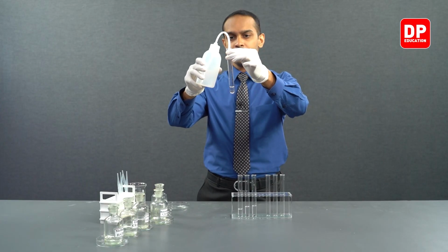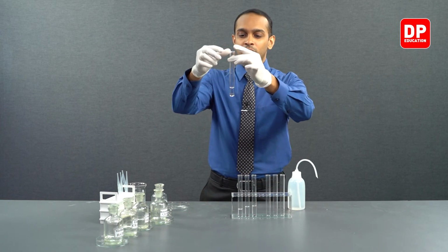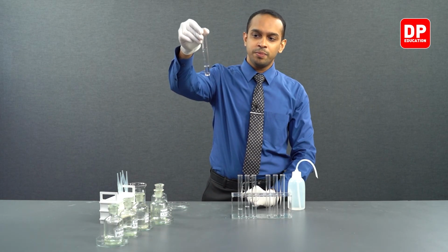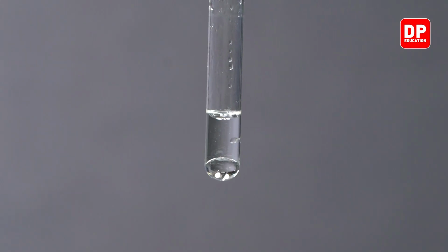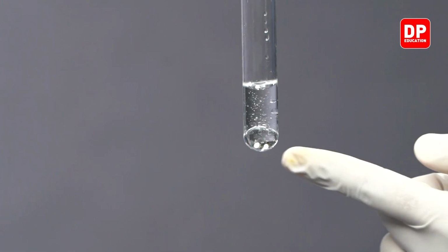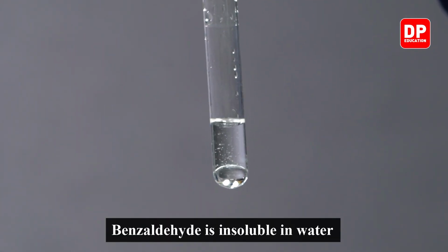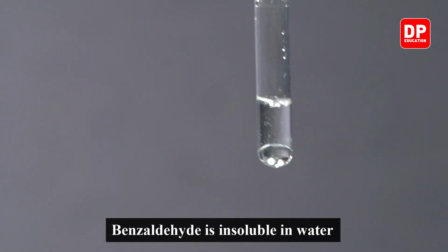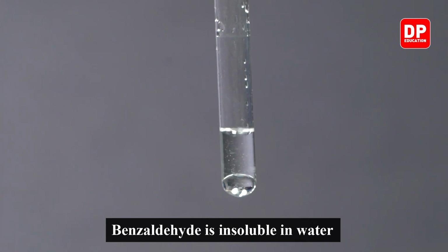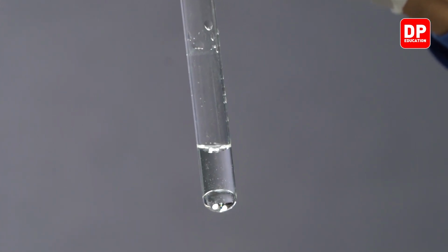You can see, when water is added, we can very clearly see formation of two layers. At the bottom of this test tube, we have our benzaldehyde. It's high in density, so it has sunk to the bottom. And over on the top of this particular test tube, we can see a layer of water present.